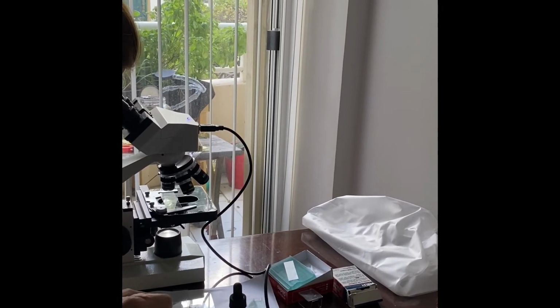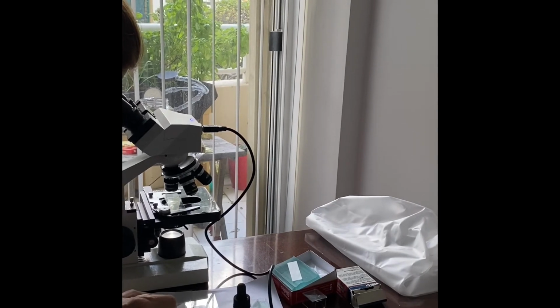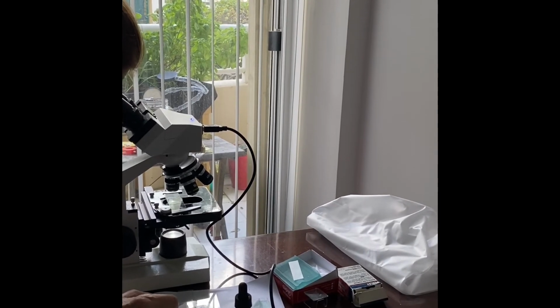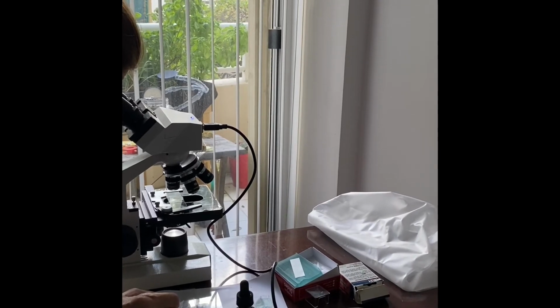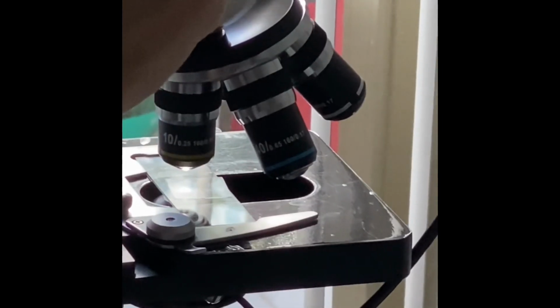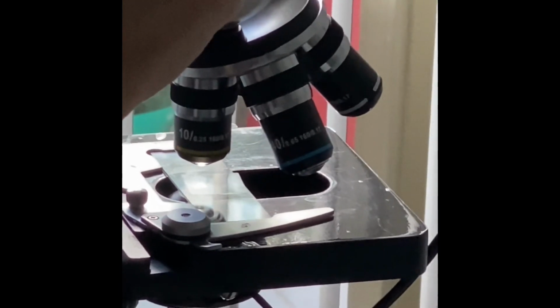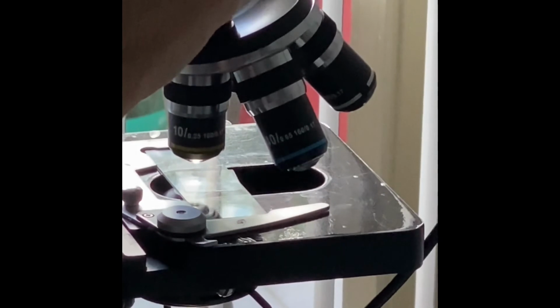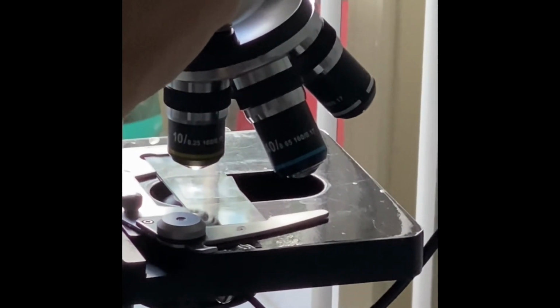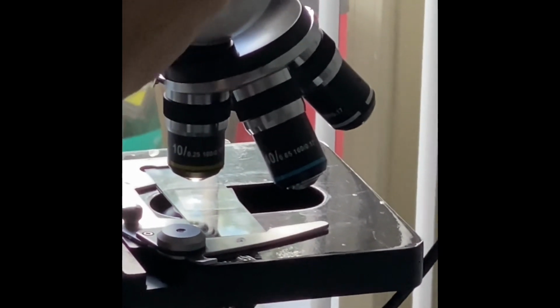The conclusion should state the purpose of the experiment as well. So we can successfully conclude that we saw many marvelous paramecium swimming and having fun.